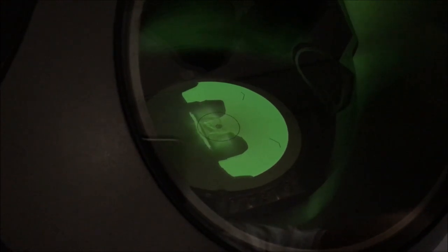If you go too far past eucentric height you start to get contrast back, meaning you're no longer at eucentric height — so you're trying to minimize the image contrast. This method is only valid assuming that the lens setting for eucentric focus has been properly configured by whoever is managing the microscope.